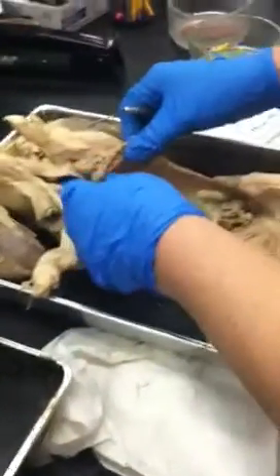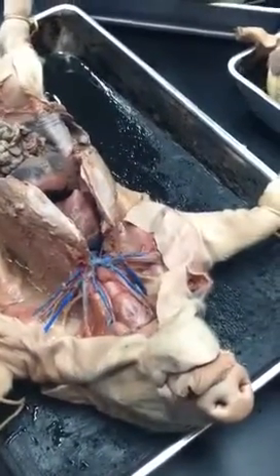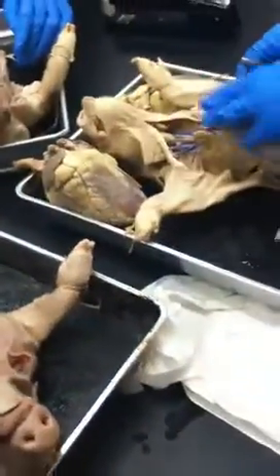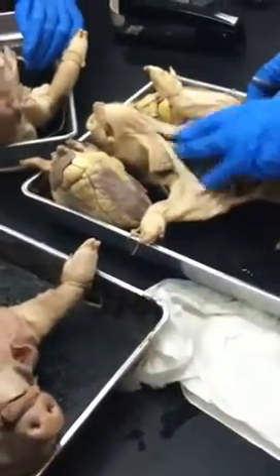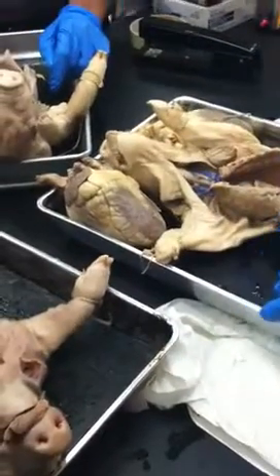Thyroid and thymus. Here you can see the thyroid, this bean on top of the trachea. That's the thyroid. And then the thymus was everything we removed. So all those bands, that gland stuff that you had to just pick through and pick through and pick through and pick through, that was the thymus.